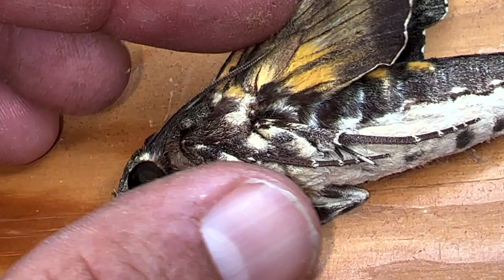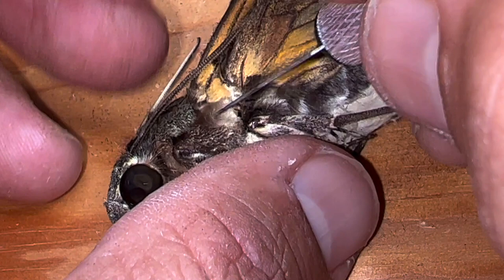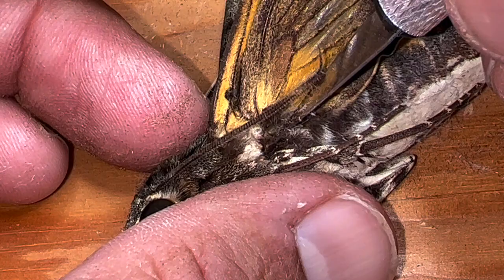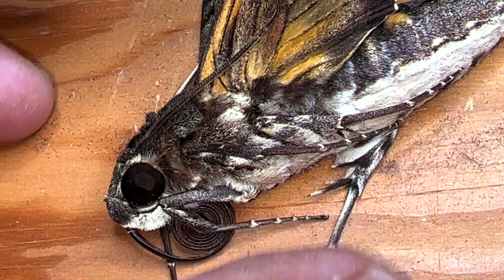Tendon number one: follow the wing down — the vein goes right here. I'm not going to remove any scales, but I know the vein is right there — boom. Same thing with the hind wing: the vein comes down, it attaches right here, I'm going to go a little further down, and you can feel it — done. My sphinx moth is officially ready to mount.